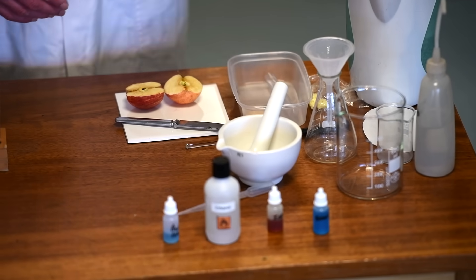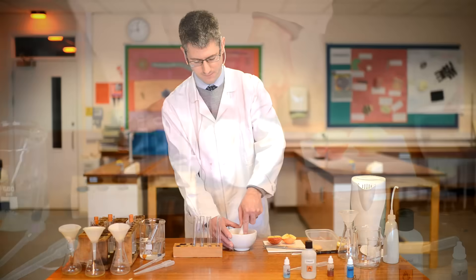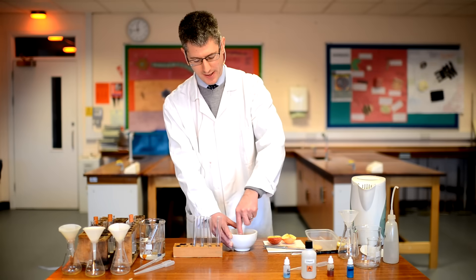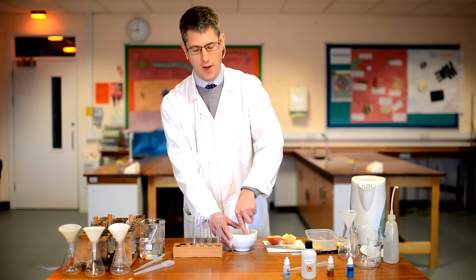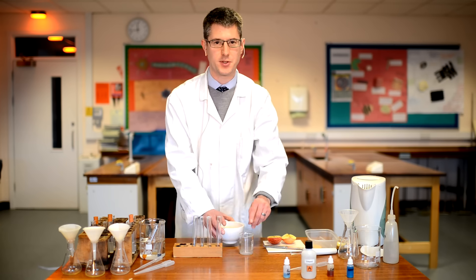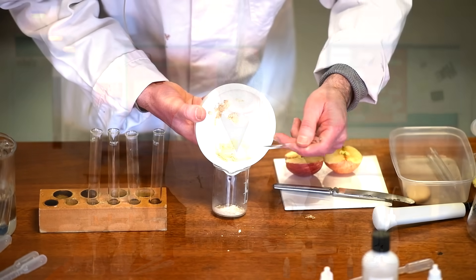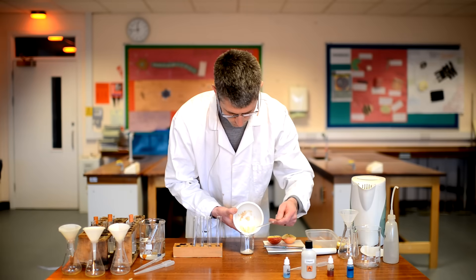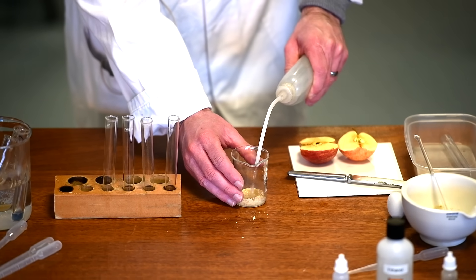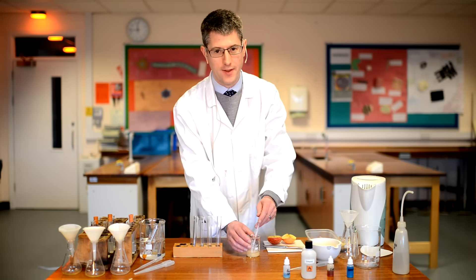Starting with the biscuit, the first thing to do is take a small sample of biscuit. We then grind that biscuit sample up in a pestle and mortar, just trying to grind it up to nice small pieces. Grind it up nice and small. We're then going to transfer the biscuit into a small 100ml beaker, and then add a small amount of distilled water — it doesn't really matter how much we add, just a reasonable volume. It then needs a really good stir.